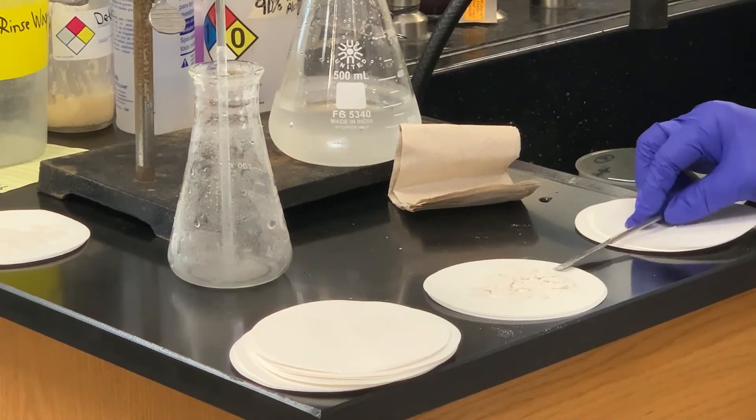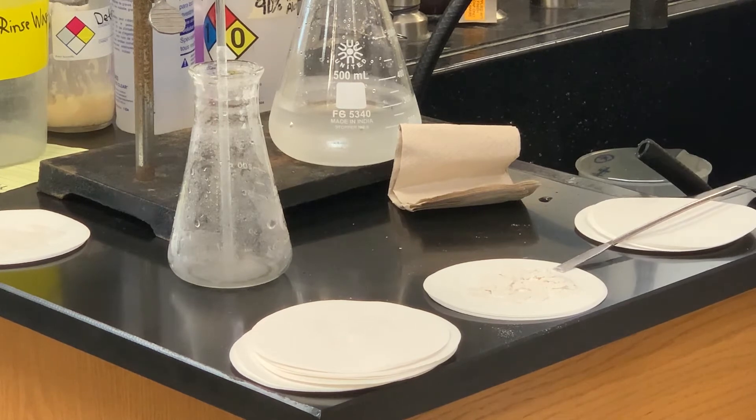Okay, I'm going to weigh these two different sections together, and then give you the weight and then the melting point.